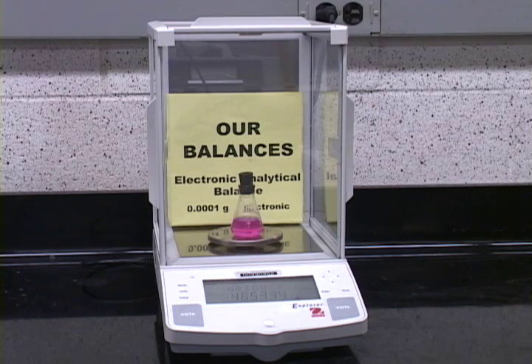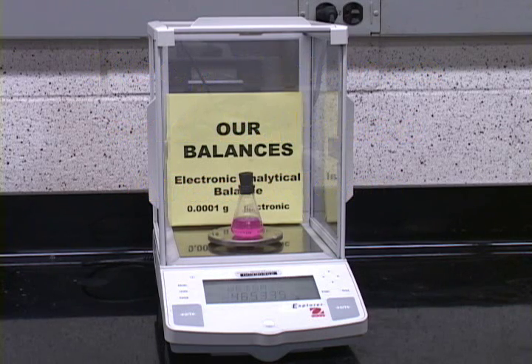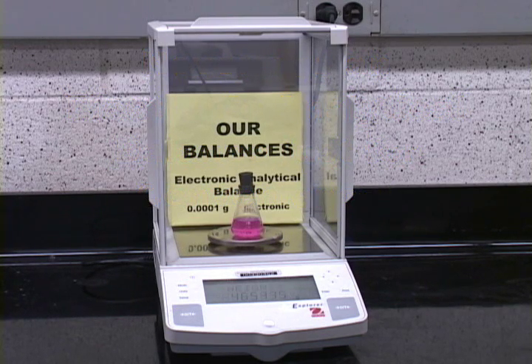Finally, make sure that you keep the area around all balances and the balances themselves very clean. This goes for all balances. Now, as far as the electronic analytical balances, they are very convenient to use, but they are sensitive and should be used only for the most accurate measurements which are required by the experiment. Your manual will tell you when to use them.